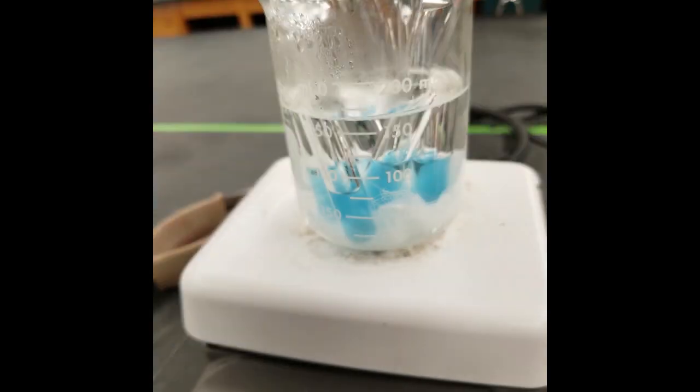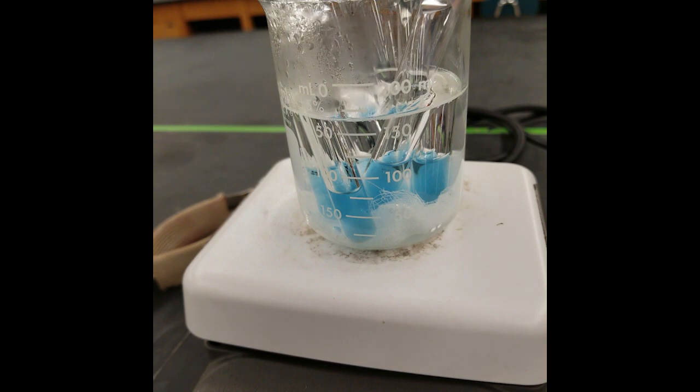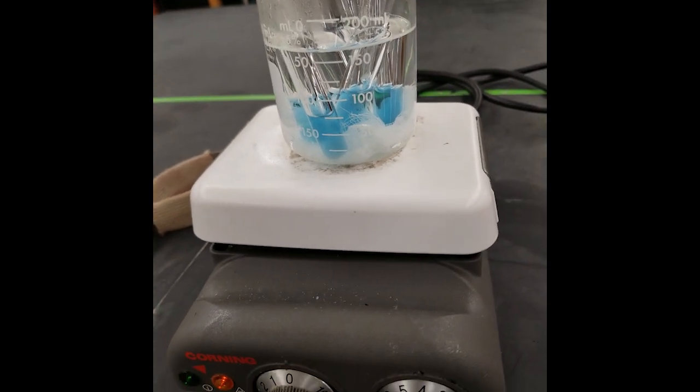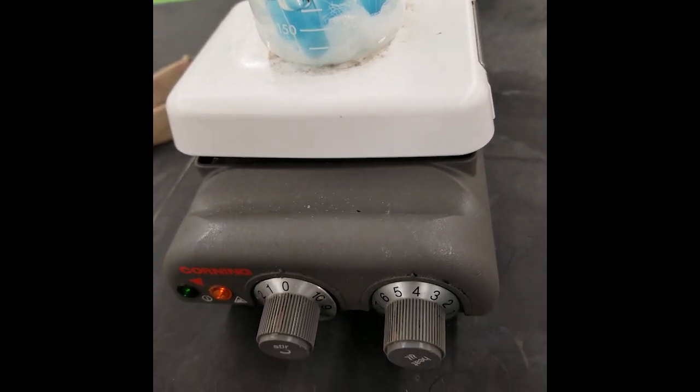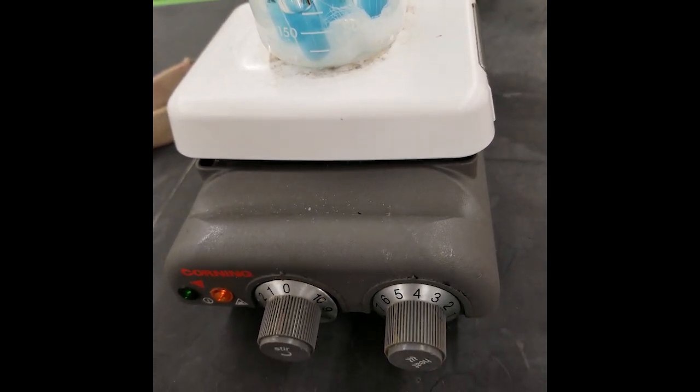As you can see here, I'm already six minutes into my boiling step and I've already dialed it down to a four from the initial six during my preparation step. Notice the small amount of boiling at the bottom of my beaker.